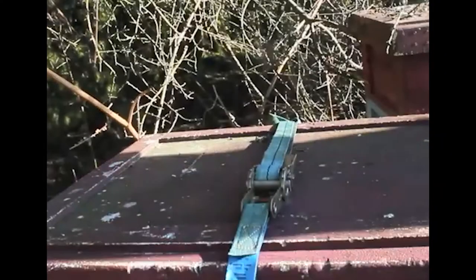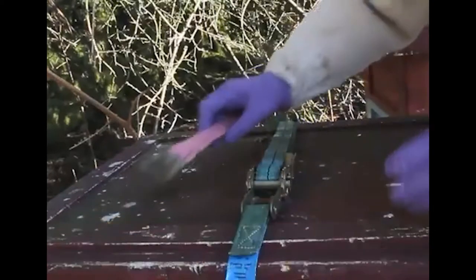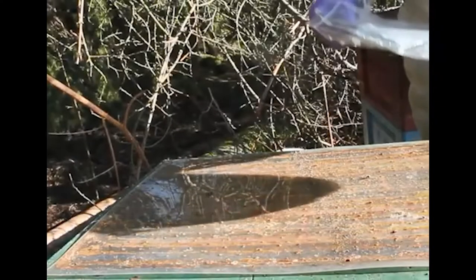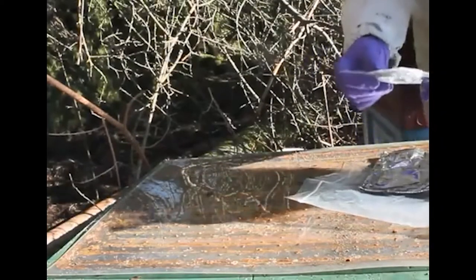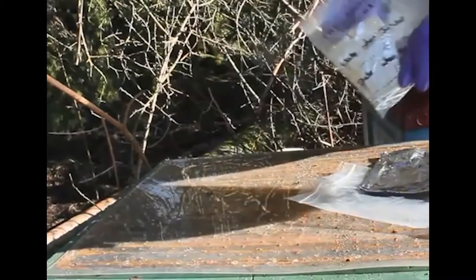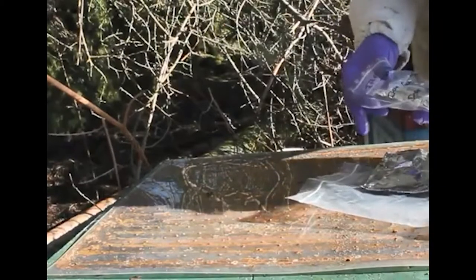Now I'm here at the hive and I just need to take the cover off the hive to put in this sampler - that's the crown board. This stock of bees hasn't been opened all winter so the frames will be kind of stuck together. Here's the sampler in the packet - it's the Irish sample test one.